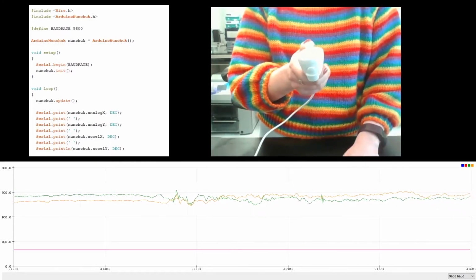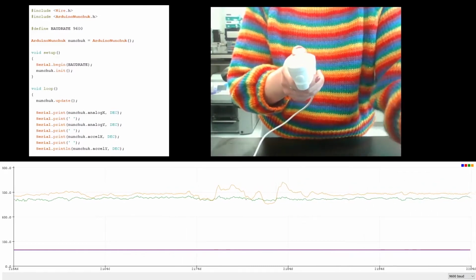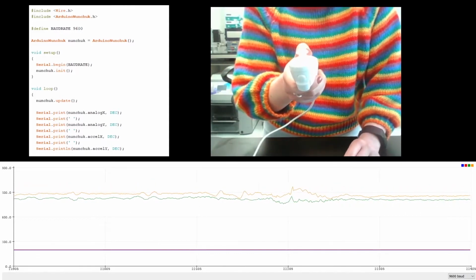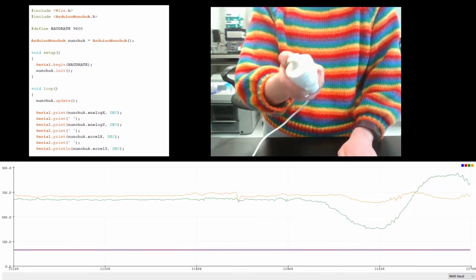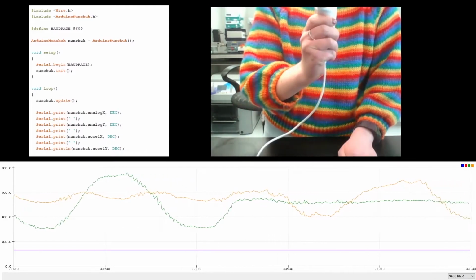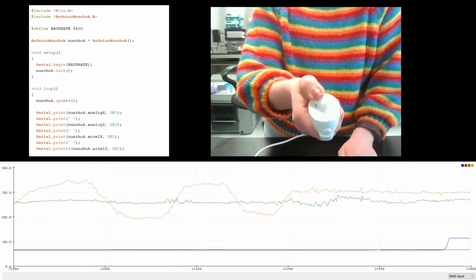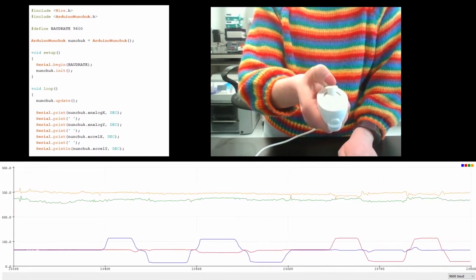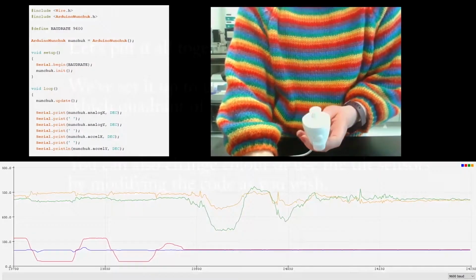So in the panel on the bottom we can see the signal coming from the sensors in the nunchuk. In the top left hand corner we can see the code that we've used to program the nunchuk. So each of those lines on the bottom there represents a movement of the nunchuk. So if we tilt the nunchuk side to side, we see the green line moves. If we tilt the nunchuk up and down, we see the yellow line moves. And then when we move the joystick on the nunchuk side to side, we see the blue line moves. And up and down, the red line moves. So using this, we can control the lights on our pixel ring.